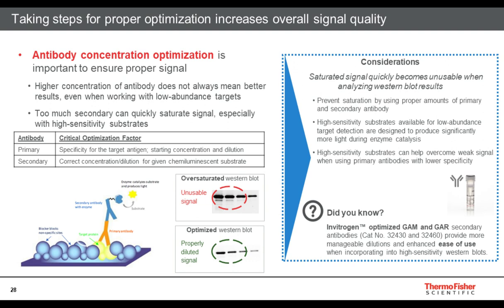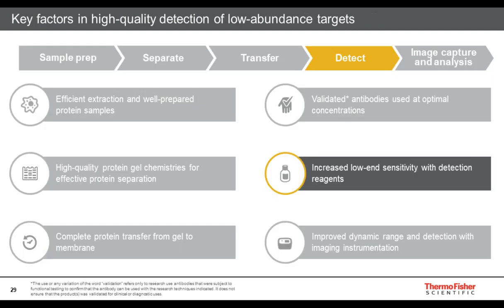The data shown in the middle of this slide illustrates oversaturation and optimal saturation in a Western blot. Too much signal, as seen on the top Western, makes it difficult to analyze, quantitate, or make conclusions. This often is the result when too much antibody is being used on the blot. Conversely, when properly diluted and optimized, the bottom blot shows a much easier to analyze Western across varying load conditions. In addition to using validated antibodies at optimal dilutions, using detection reagents specifically designed to increase sensitivity can help improve detection of low abundance targets.